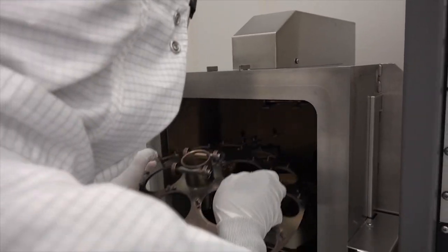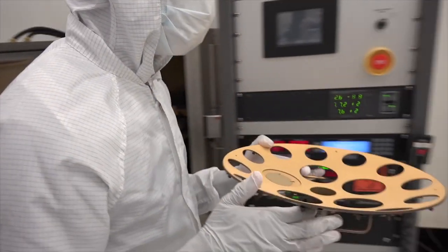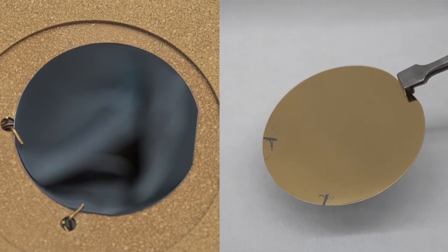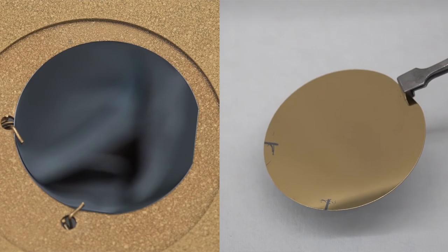Let's remove our wafer from the dome. You can see the nice gold-colored film.